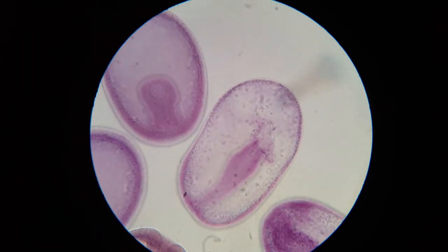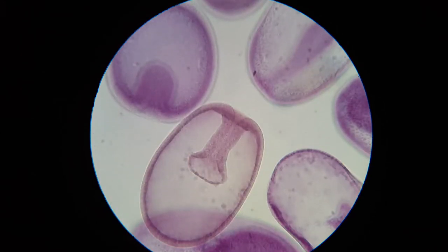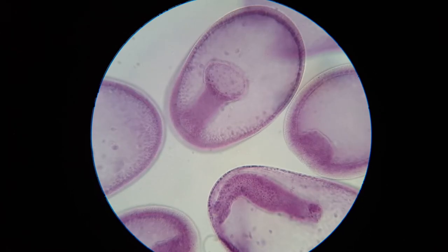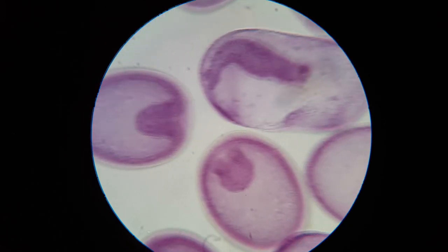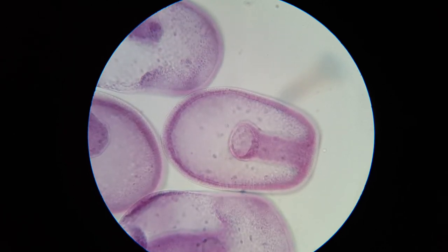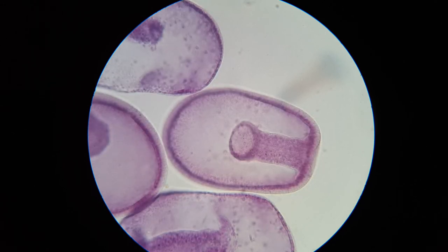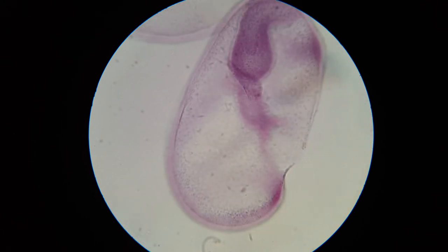The process of gastrulation is the formation of the primitive gut. We're still at the 40x objective, and you can see various stages of invagination — from very early to somewhat later to even later. That's the formation of the archenteron, the primitive gut. It only has one opening. Isn't that pretty? So that's the primitive gut you're looking at — Starfish Gastrula. Gastrulation is how you get there, and it's the archenteron that's been formed.